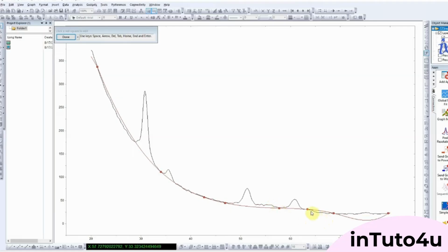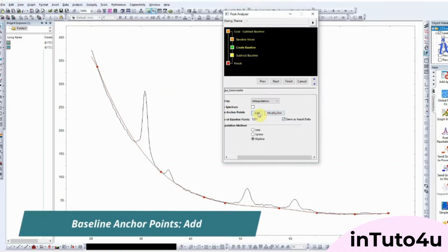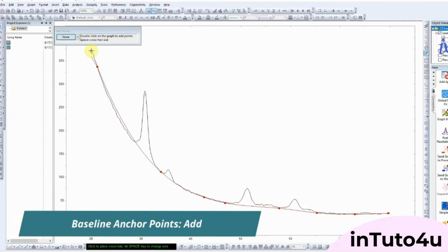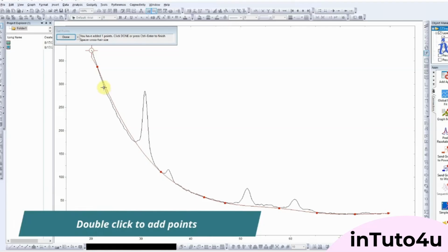Here, you'll find the interpolation method. Select B-Spline. This method creates a smooth curve, which is ideal for following background trends in your data. After choosing B-Spline, click Modify. This opens the interactive graph. Take a moment to look carefully at the curve. Now, adjust the baseline by moving the points, drag them so the curve runs along the background, not through your peaks. When the shape looks correct, click Done.